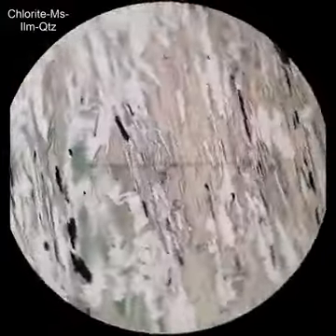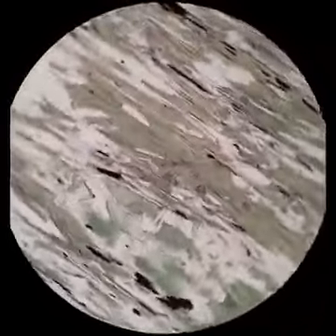And this is an unusual chlorite. It's a little bluer in plain polarized light for pleochroism than most. But what makes it really distinctive is when you cross the polars, it has the most spectacular purple color. It's the only time I've ever seen chlorite that's quite like this. Isn't that beautiful?